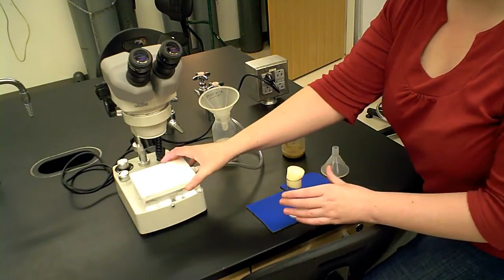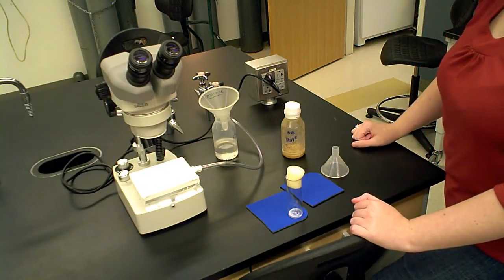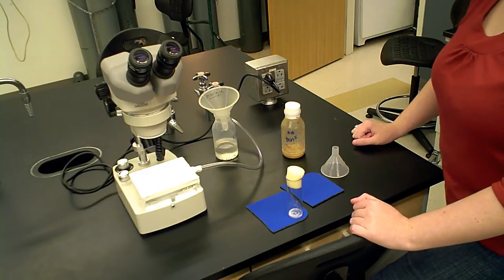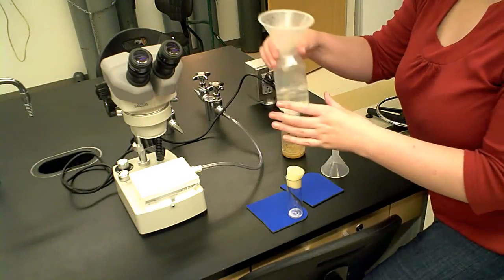Then you can move the pad to the microscope and you can look at them, sex them, divide them, whatever you need to do under the five-minute time period.